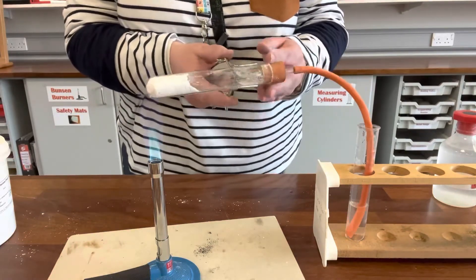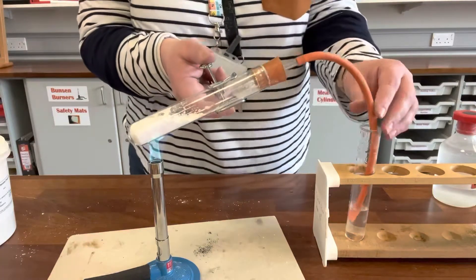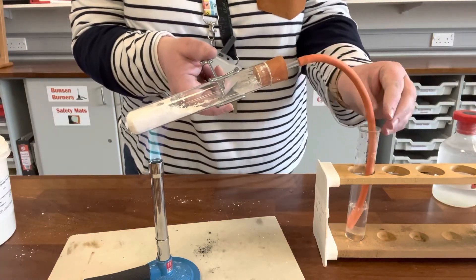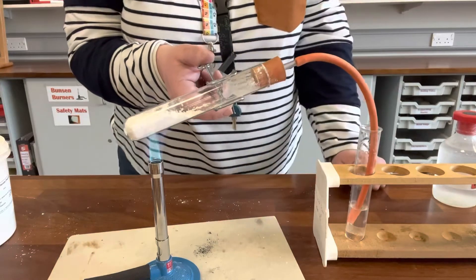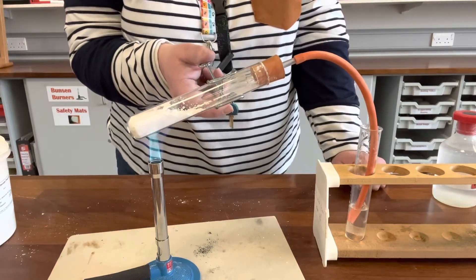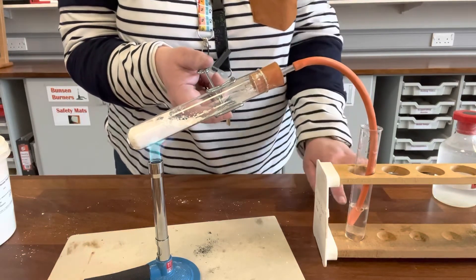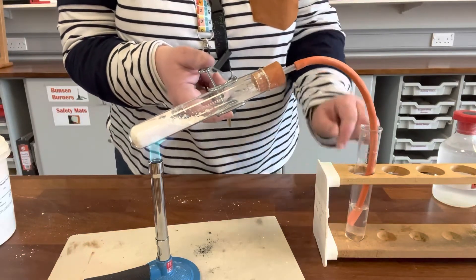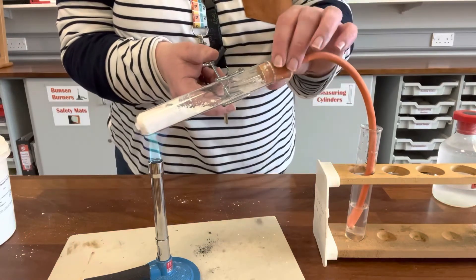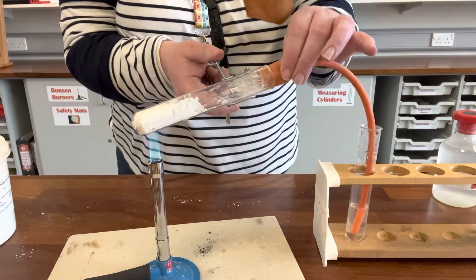So if I heat this gently and spread it out a little in the test tube, we should get carbon dioxide gas given off. Again, this is a thermal decomposition reaction — there's nothing else added to it. We just heat the reactant and it's the heat that causes it to break down and decompose. We're starting to see some bubbles being produced here, and if the lime water turns cloudy that will prove that carbon dioxide is produced.